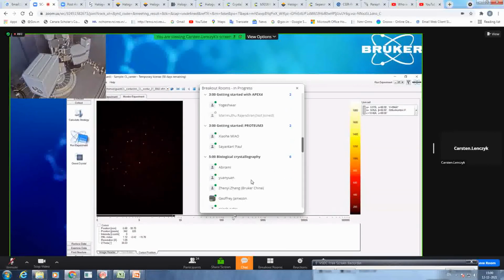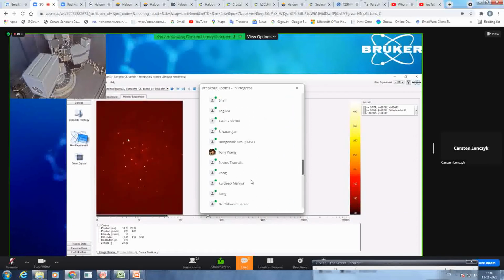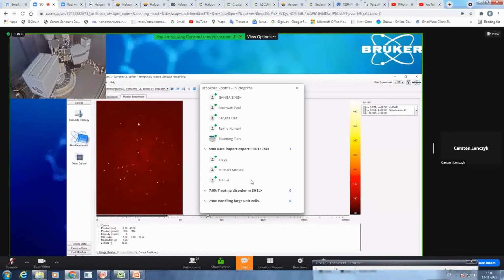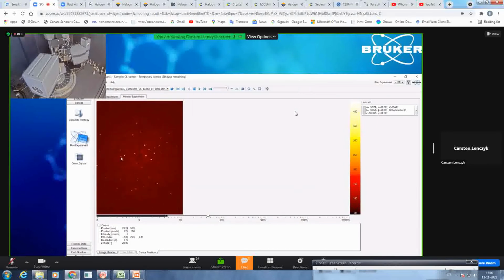Okay, so what we do now, I would let it run and just look closely at the frames passing by. First I have to check how well the spots are separated. You don't want to have them overlapping. In case they do, it's either twinned, or you can try to increase the detector distance. That would be the first thing I would do. You see now here, the spot separation, as far as you can see, is nice. So we can even decrease it. I guess we currently measure at 50. We can also decrease it to 40 millimeter, and we will still get some very nice spot separation.